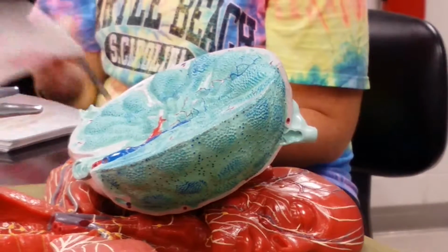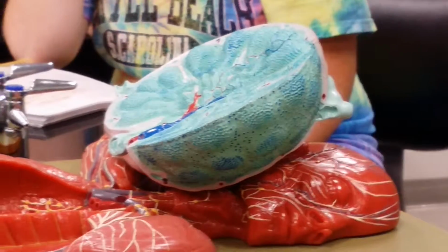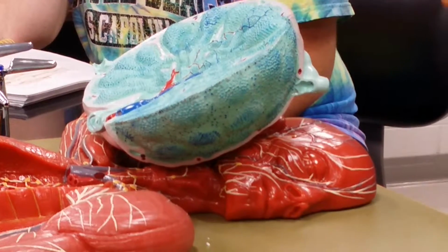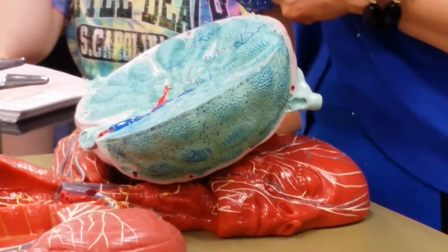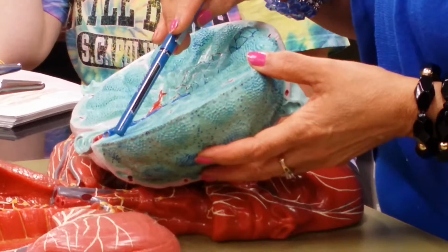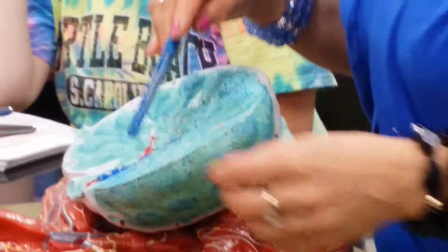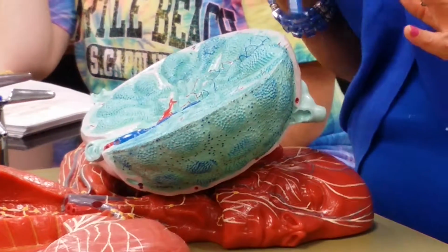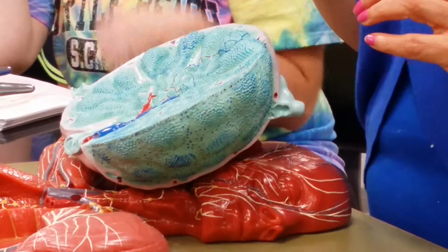So as lymph passes through a lymph node, if it has disease-causing agents, the lymph node knows to produce lymphocytes in response, which know to produce antibodies in response to that antigen. So a specific antibody will be produced for that specific antigen, which is in the lymph and therefore in the blood and other places in the body. So this is one cortical nodule. This is the cut open view where you can see the germinal center. See how many labels we already have here: 1, 2, 3, 4, 5, and 6. And more to come.